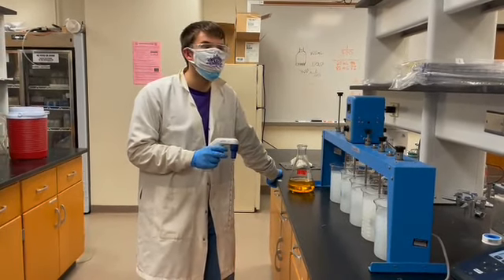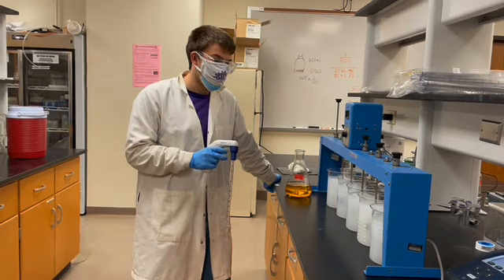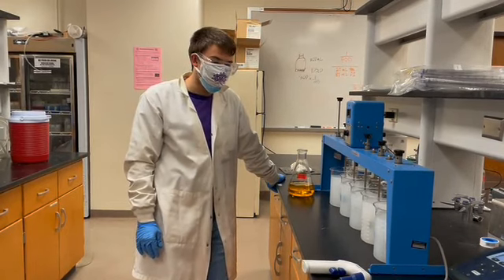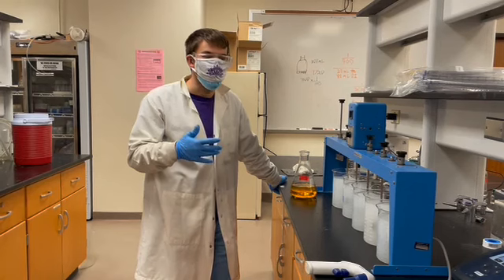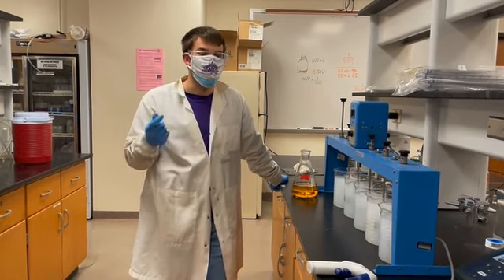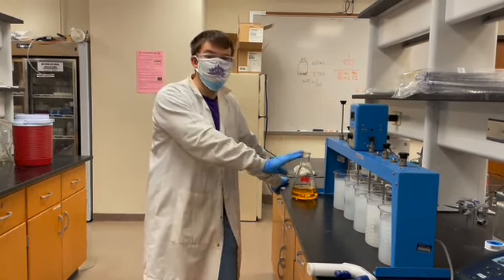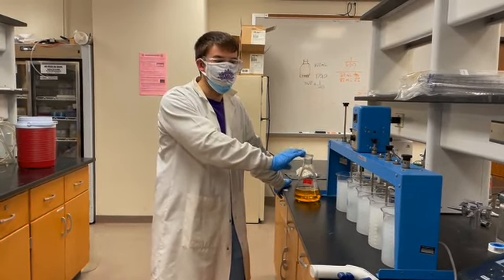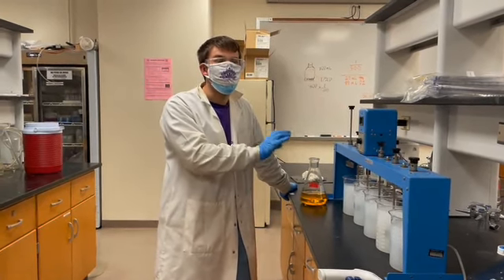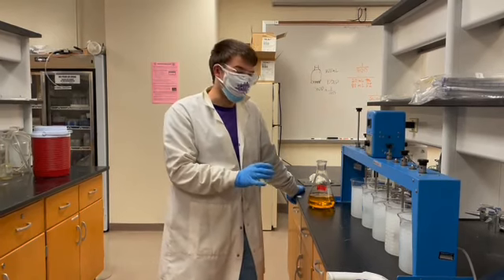Welcome to lab 4. We're going to be doing the coagulation and flocculation lab. In the lab lecture video, we should have talked about the fundamentals and the mechanisms behind coagulation and flocculation. And we will simulate that with the jar testing. Rapid mixing of the jars will simulate the coagulation process in a drinking water facility, and the slower mixing speed will represent the flocculation process.